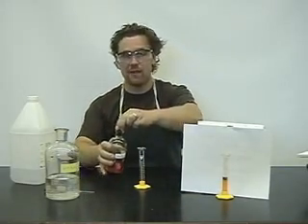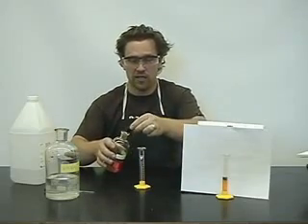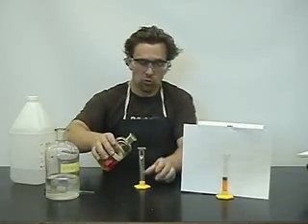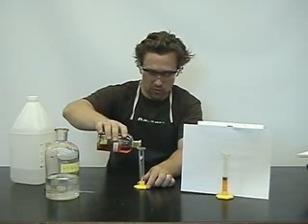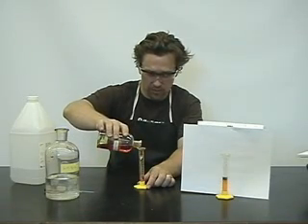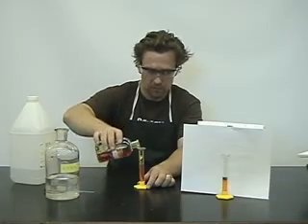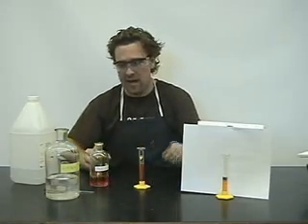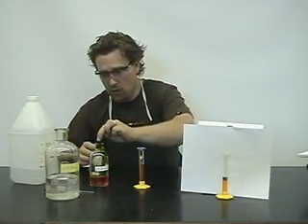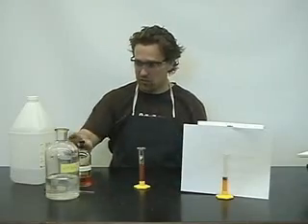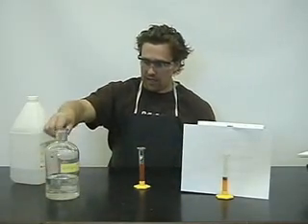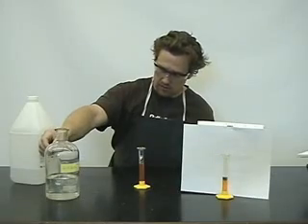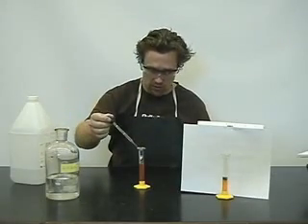Now we're just going to do a quick example to show you what it looks like. So we're going to add about nine mils of 0.1 molar potassium dichromate. Now you'll notice also in the reaction that we require an acidic solution. So we're going to go ahead and add some six molar sulfuric acid.